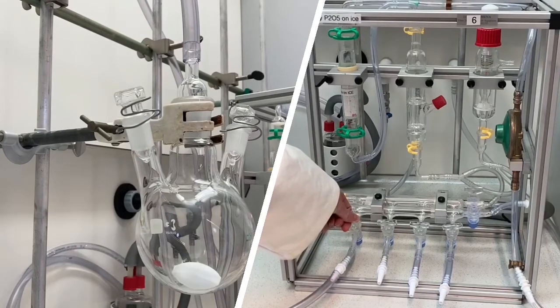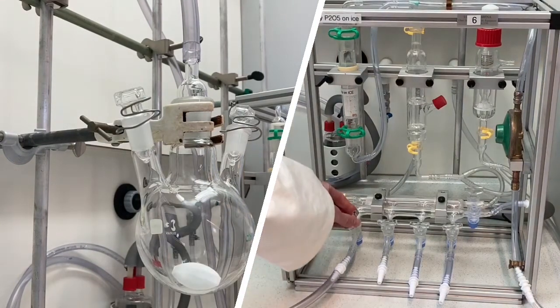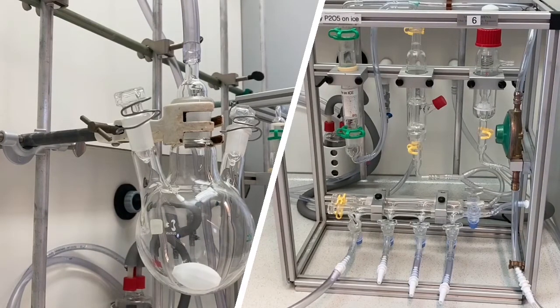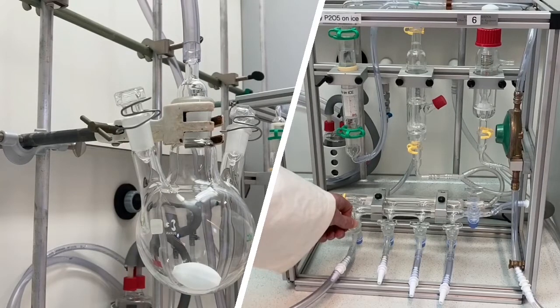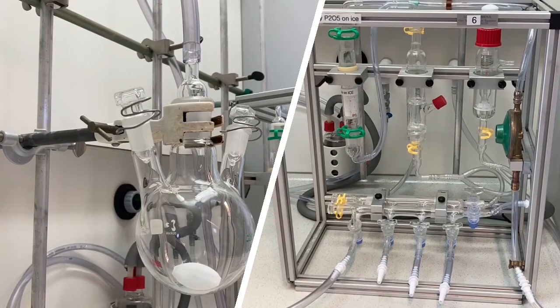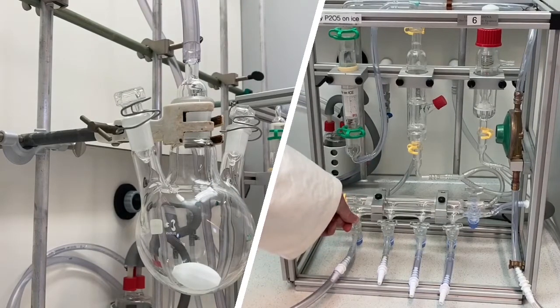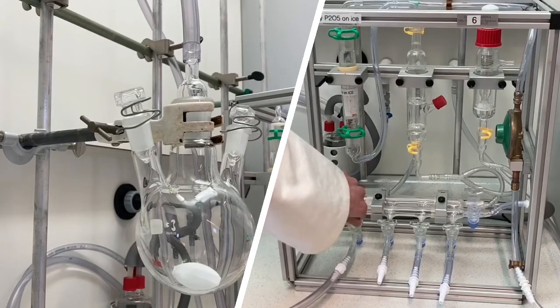When it is at full vacuum, go back to filling with nitrogen. As you can see, the bubbling has almost stopped, so close it back and then go back to vacuum. When the system is fully on vacuum, do one last cycle and fill it up with nitrogen again.